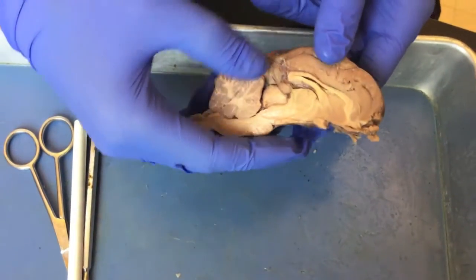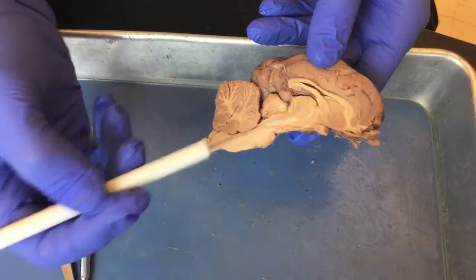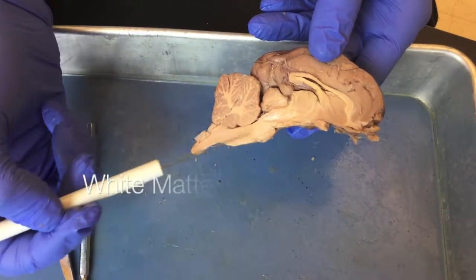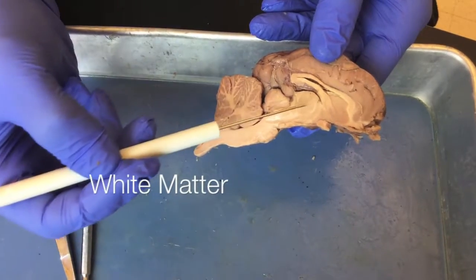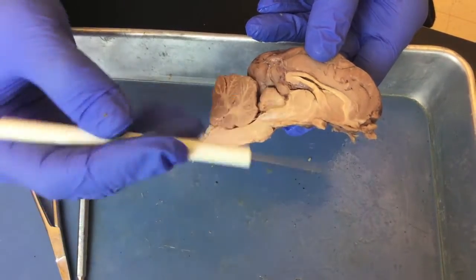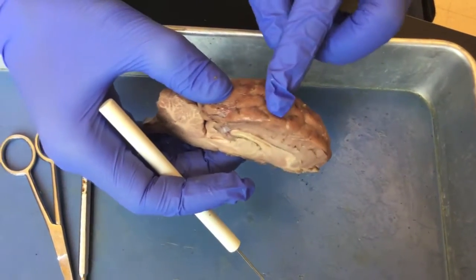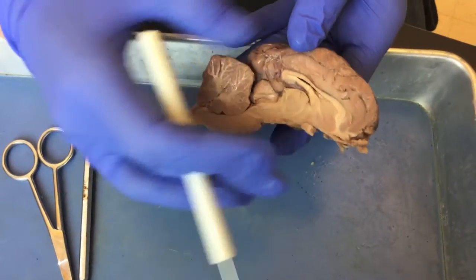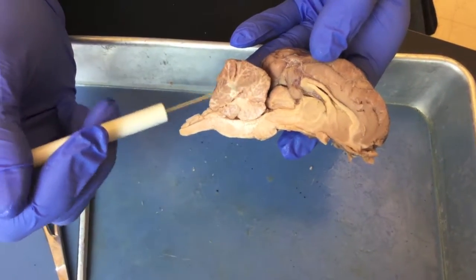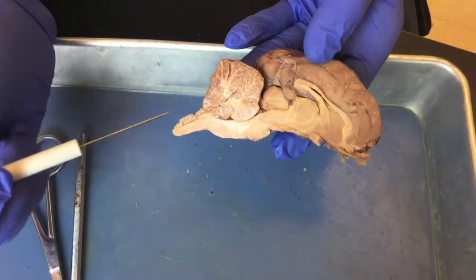However, when you look on the inside of the brain, deep, you'll notice that some of the tissue has a whiter color, and we call this white matter. And this is because these are myelinated axons of those nerve fibers. So typically in the brain, we see that the gray matter is superficial and the white matter is deep. And that's also true in the cerebellum, where the gray matter is superficial and the white matter is deep.